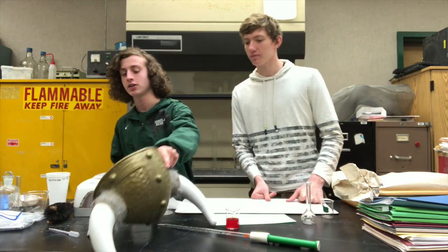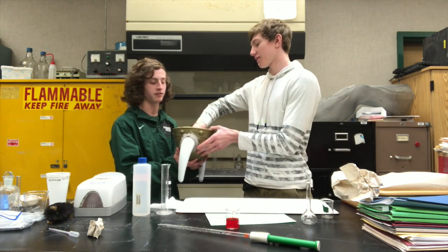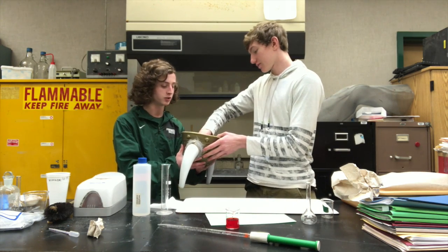We're going to show you guys how to do the dilutions lab. So first, we select our 3 dilutions that we want from this Mr. Sid's hat of awesomeness, of course. Coop, will you do it? Of course.